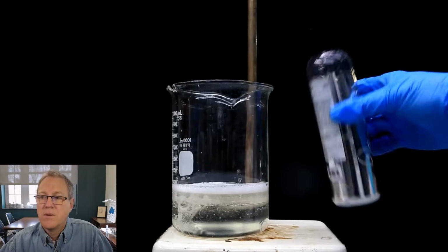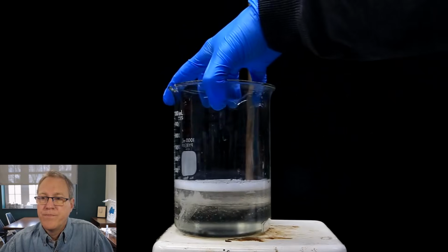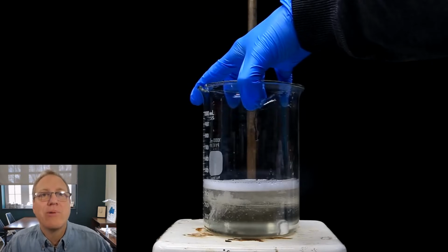I did a second washing just to clean the bottle as much as possible, but at this point it was already pretty clean. So did he get 100% of the material? Probably not. But did he get over 99%? Probably so.